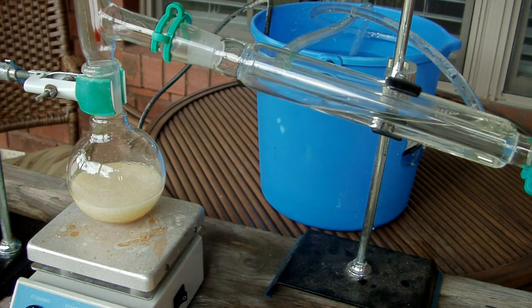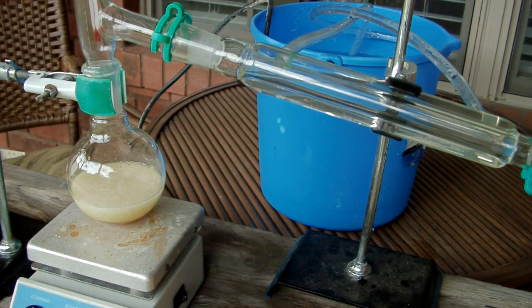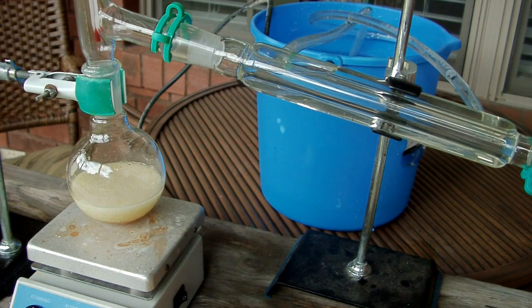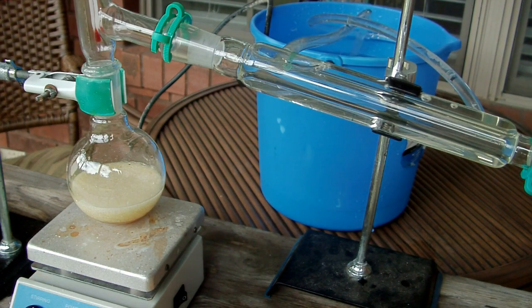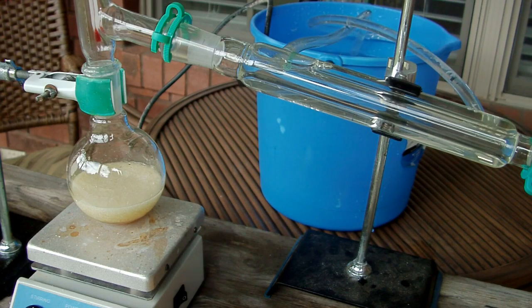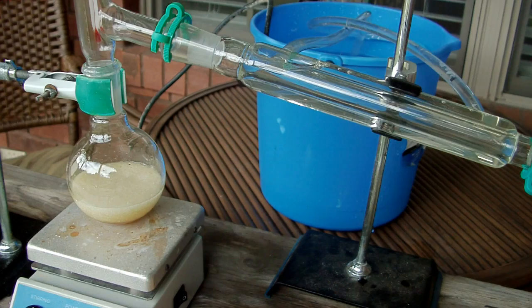And this distillation needs to be carried out at about 82 or 83 degrees Celsius for the nitric to boil over. And my hot plate is not that great of a hot plate. It gets high enough to boil water, but in this configuration, what I'm going to use to help it along is an air bath.